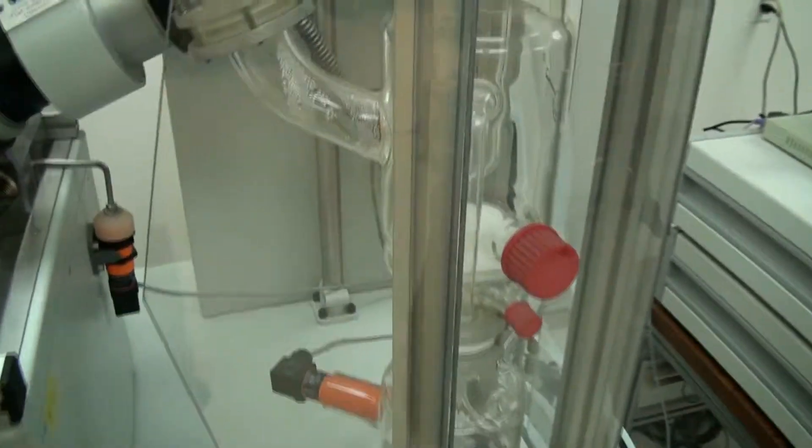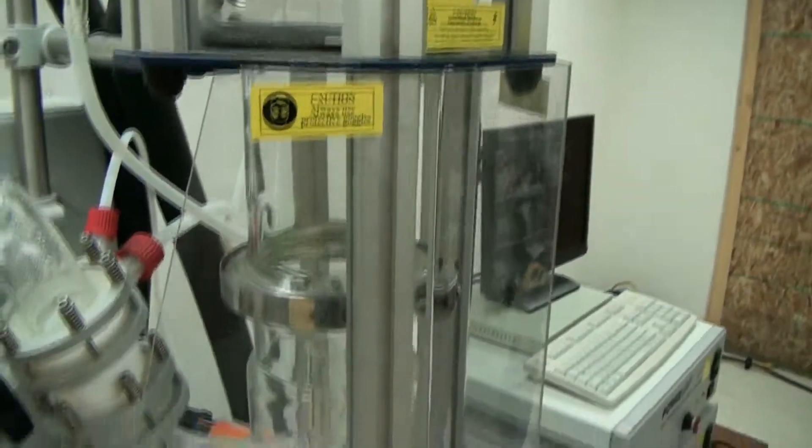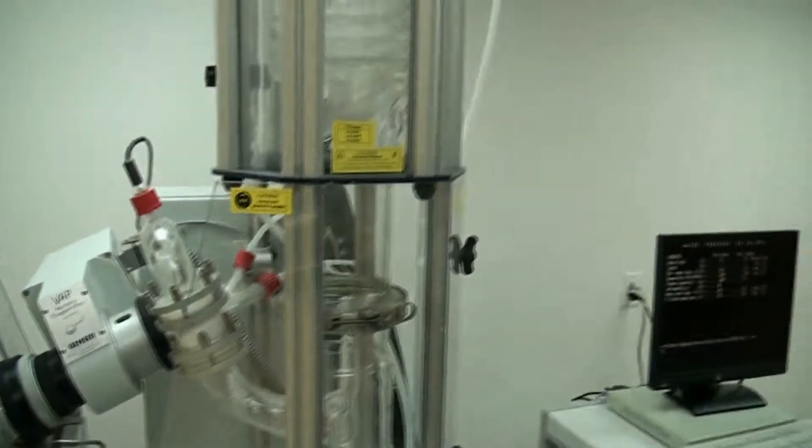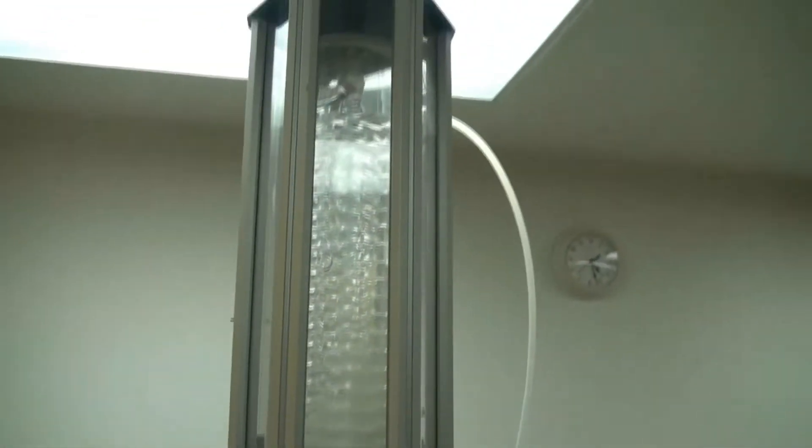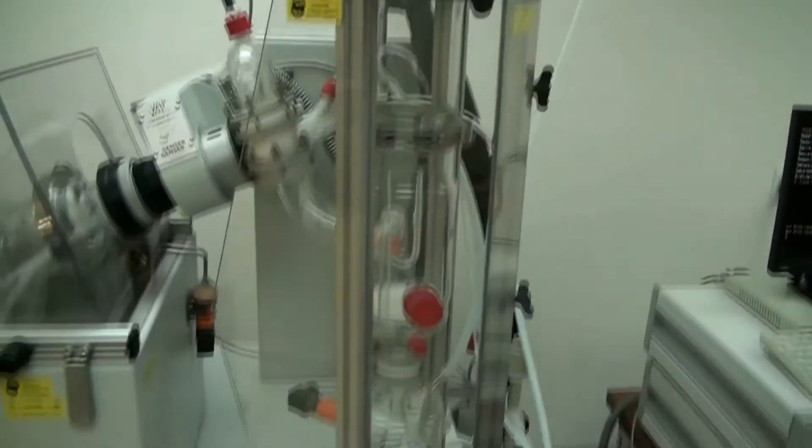The circulating pump however is still running so it's continually running the chilling water through the coil here. It just continually runs. Like I said, if it needs solution it will detect it, it'll pull more solution in. You can see right now it's loading. We're just pulling it from the bucket down there and it stopped.